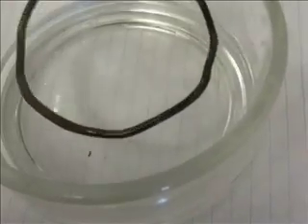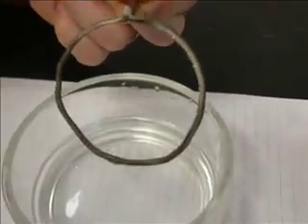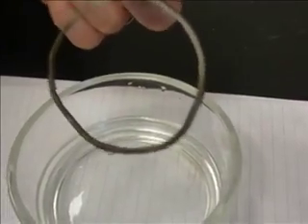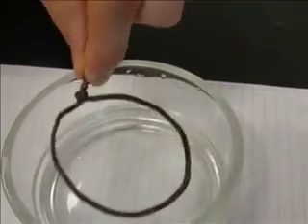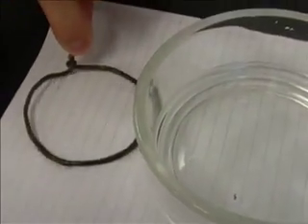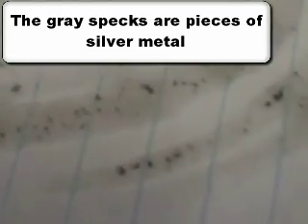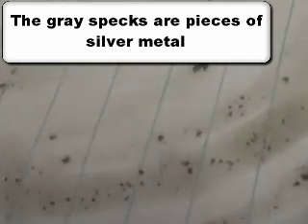So you can see on here it's actually coated with silver. Ooh, you can see really well there on the back side. That's pretty cool. Mr. Sams, why don't you put that on that little piece of paper maybe, and I bet it'll flake off. Just tap it. Some of our silver metal there on the paper. Chunks of silver. So if we were to collect that silver, Mr. Sams, we could make a ring out of it.